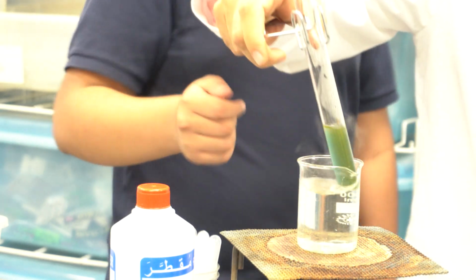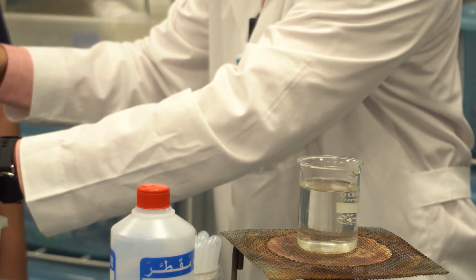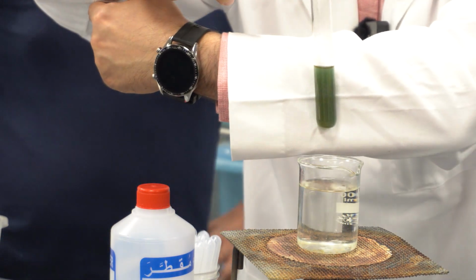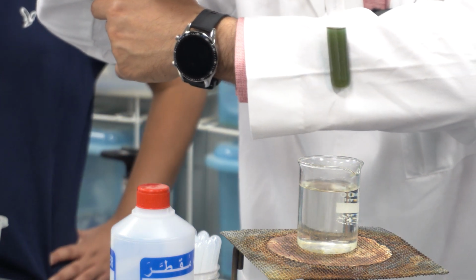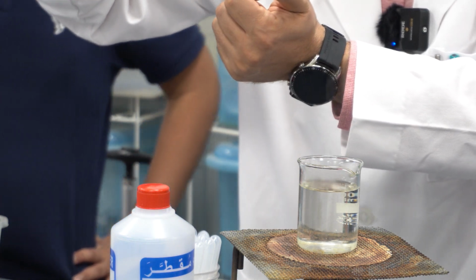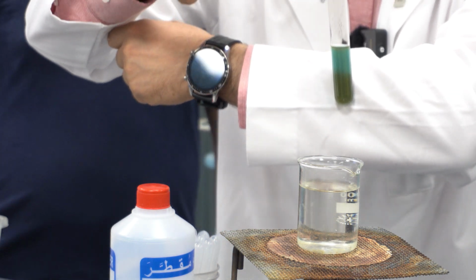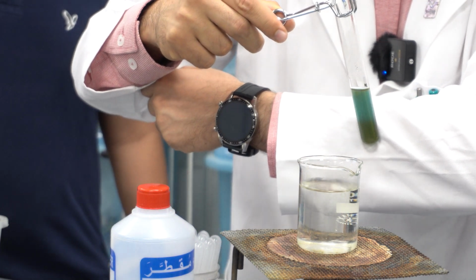Thank you, Abdulaziz. Even if I start to take it off, you can come here and you will see. Yes, you are right, it is still changing, for sure. And if I hold it like this in order to see the difference in color, there is a difference in color against the white lab coat. So you can see the differences. We made it yesterday and we had a very obvious brick red precipitate. But today the concentration of the starch is not as high as yesterday.